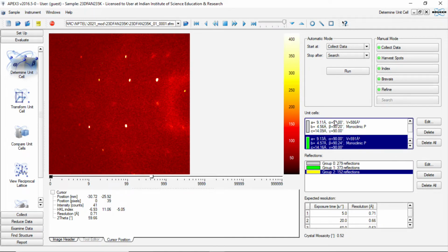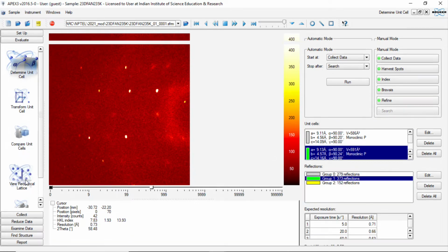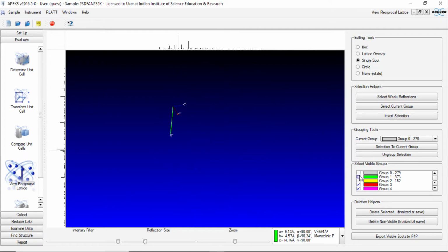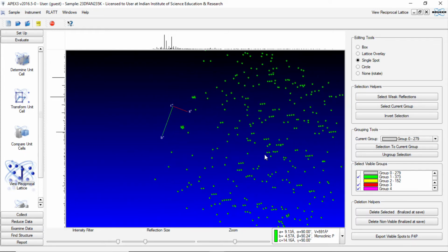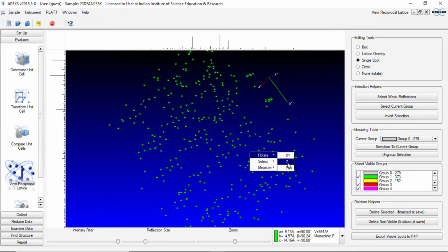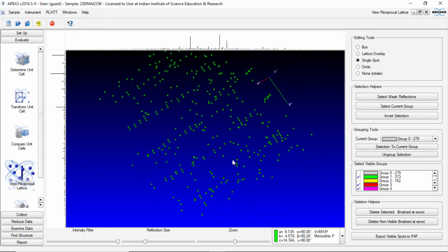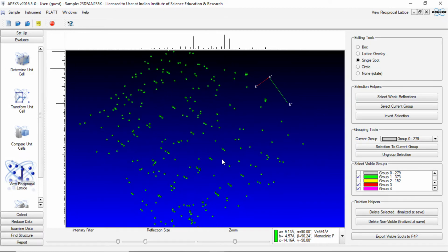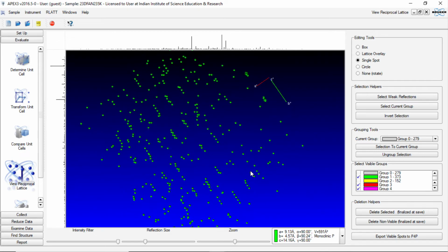So now we have two unit cells from gray and yellow. Both are giving us about the same numbers in terms of unit cell parameters. So this clearly tells that now we have two single crystals inside the lattice, inside the capillary. So now if we go back to the reciprocal lattice viewer, remove both gray and yellow and take the green ones and try to see, is there any sequence, or is there any what I would say is alignment of reflections. What we see is, yes, there is some kind of alignment of reflections. So this essentially indicates that there may be a third crystal present within the beam.